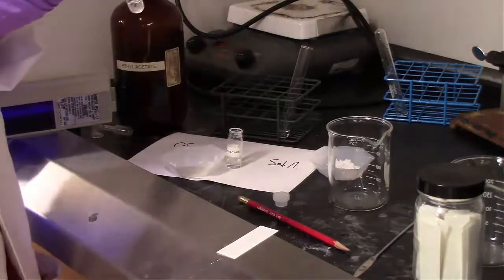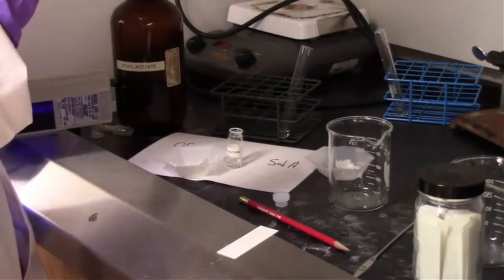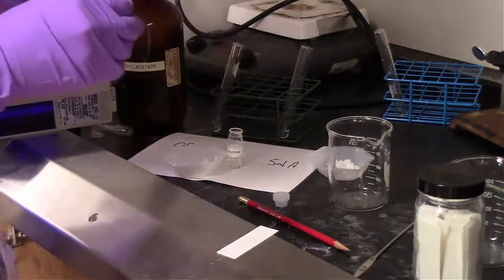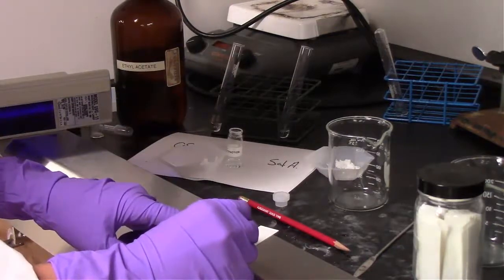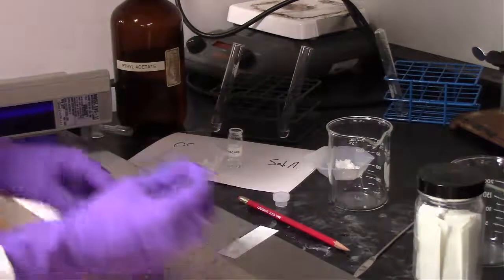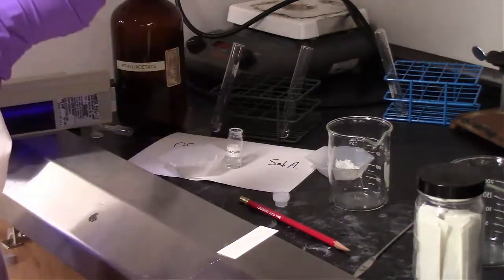And the reality is, even if more compound wasn't added here, if it would have been spotted another 10 times or so on the plate and then just let it evaporate, you probably could have had enough compound in both those lanes, because you could see a very faint amount of both caffeine and salicylic acid on the plate. So it's really just based on personal preference, but might as well be quick.